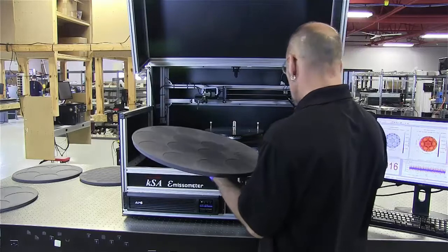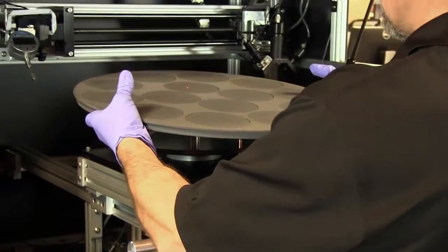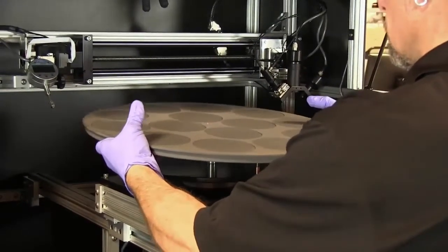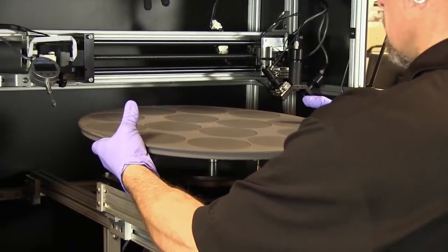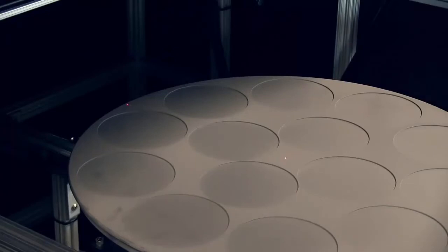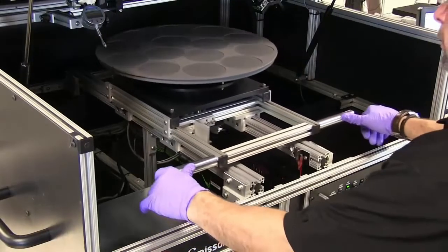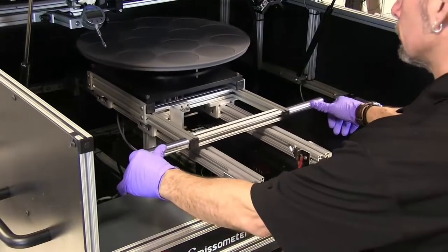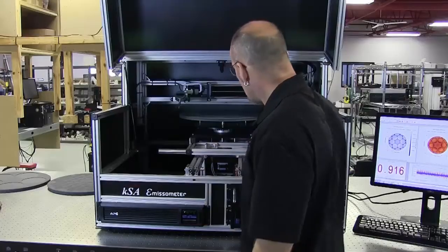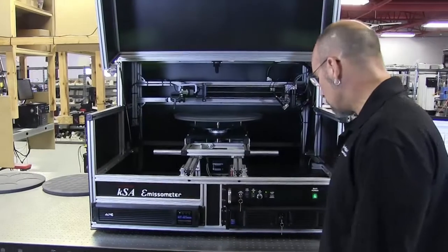A nice thing about this tool is we've got a couple of laser indicators. There's one laser indicator right at the center so you can know where to place the tool, and then you'll see a second laser indicator at the back. If you have a dimple or an alignment mark on the carrier, you can align the laser to that mark, then push the holder back until it won't go any further. There's a lock here to lock the holder into place, and now we're ready to spin up the tool.